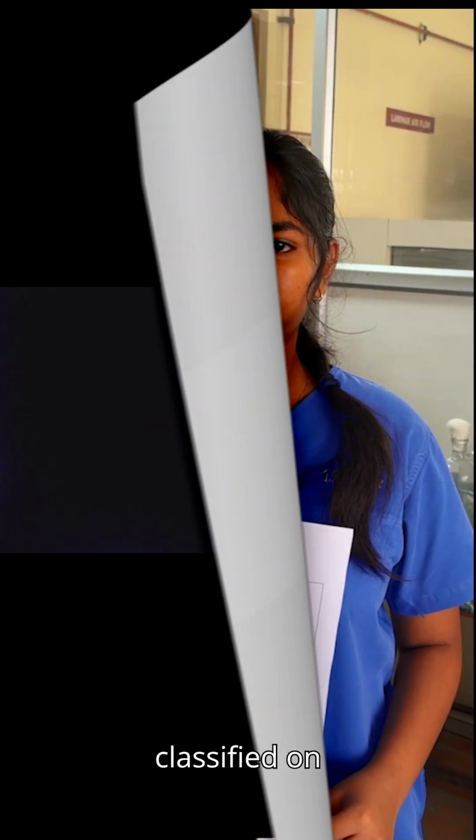Biospill can be classified on the basis of volume. Less than 10 ml of biospill is called a small spill, and larger than 10 ml is called a large spill. It is also classified on the basis of site of spill as primary containment area and outside primary containment area.